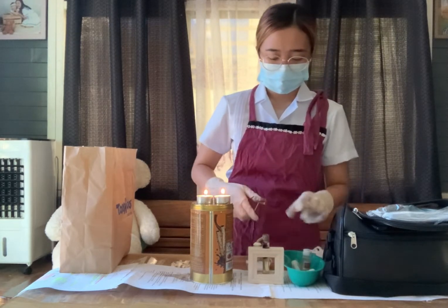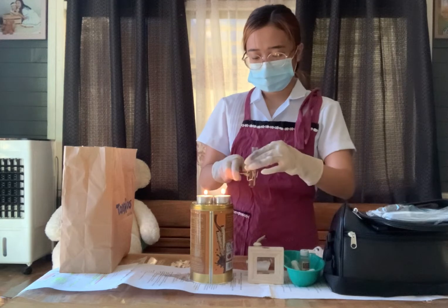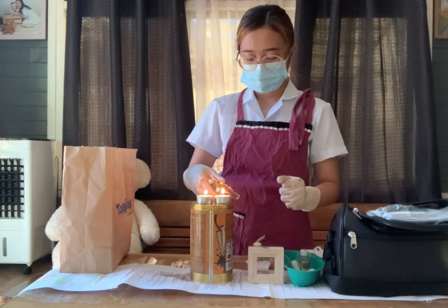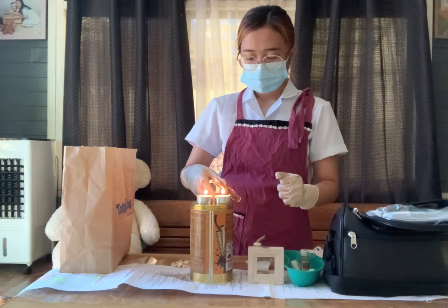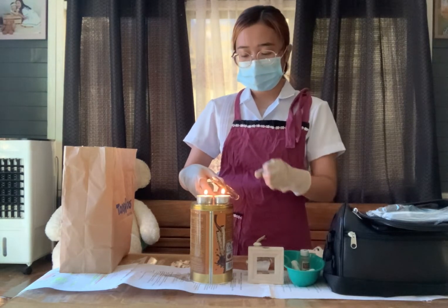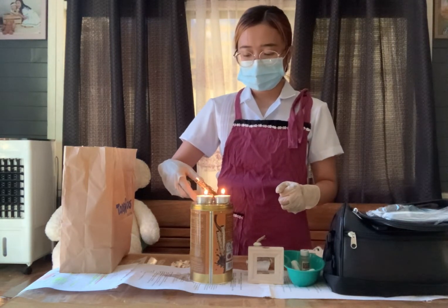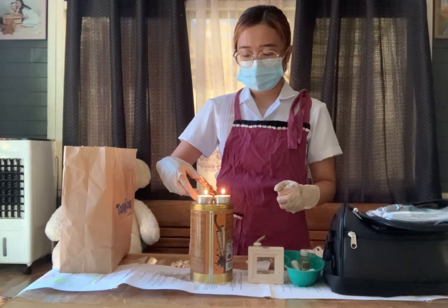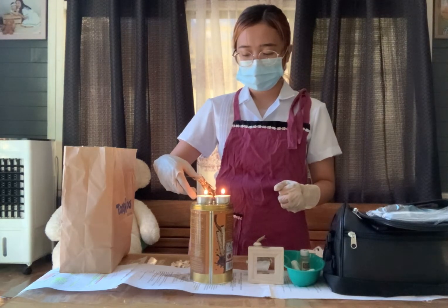Then you need to heat the test tube again. Make sure to heat the upper part, and the mouth of the test tube must not be facing the examiner or the patient.